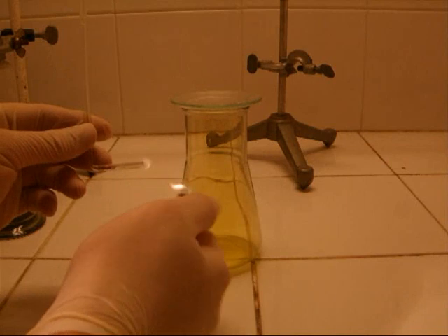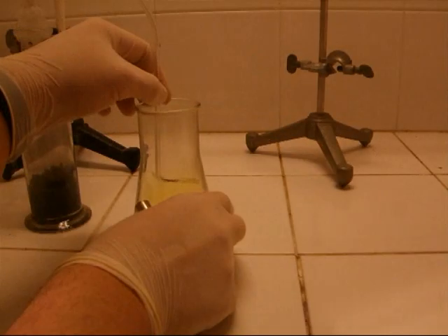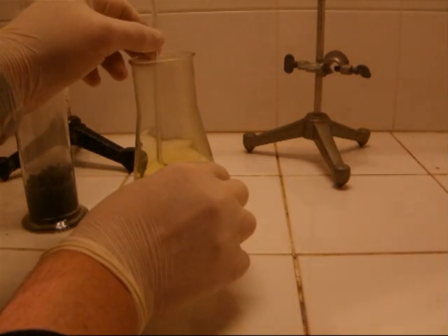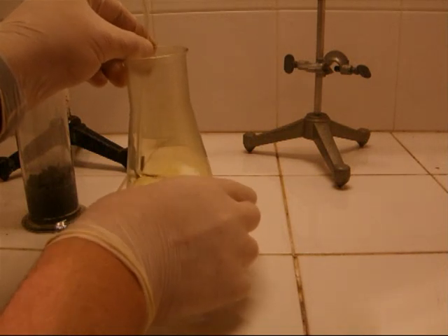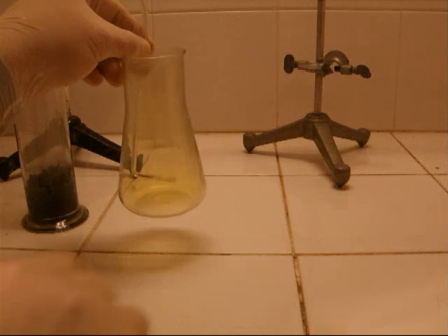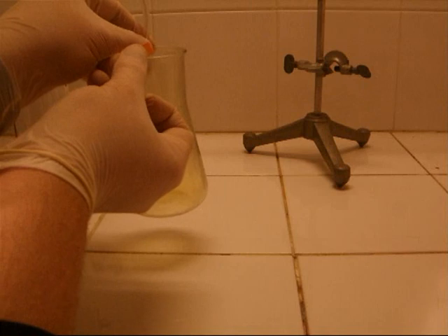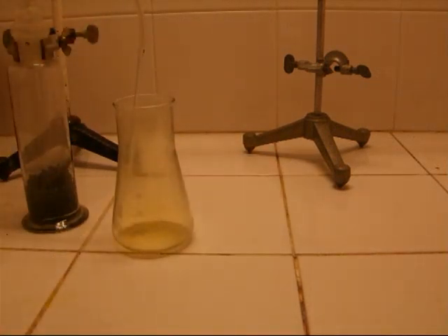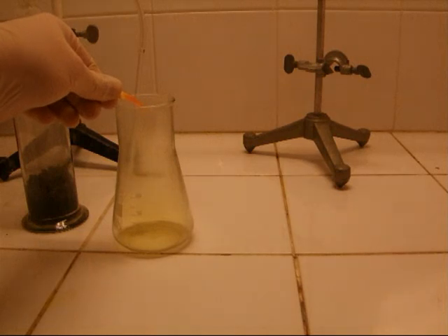The next experiment, again with the same preconditions. Now a hydrogen flame is slowly inserted into the chlorine atmosphere. You can see the color of the burning hydrogen changing when it comes in contact with the chlorine gas. In this chlorine atmosphere, the burning hydrogen forms hydrogen chloride. This hydrogen chloride is easily detected by some wet pH indicator paper. The color of the pH indicator turns immediately to red, which is a clear sign for hydronium ions.